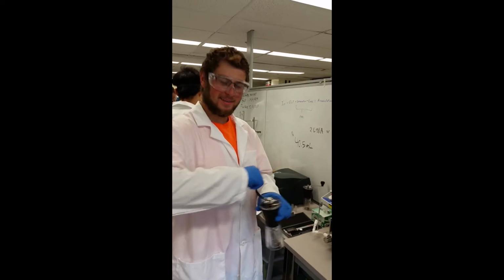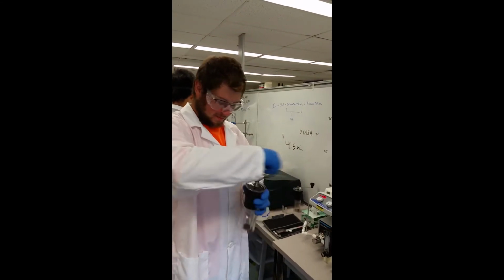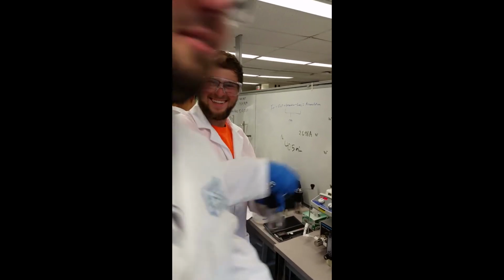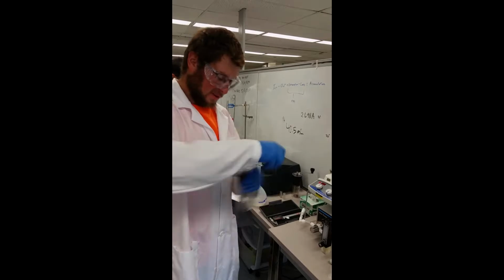So in order to get the caffeine in the coffee to enter into the liquid phase, we ground it, and then we took the coffee grounds and we weighed them to predetermined masses. And they were placed in tea bags, stapled shut, so they could be placed into the reactor.